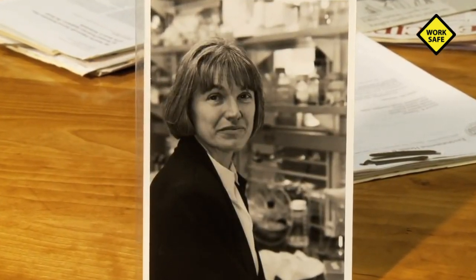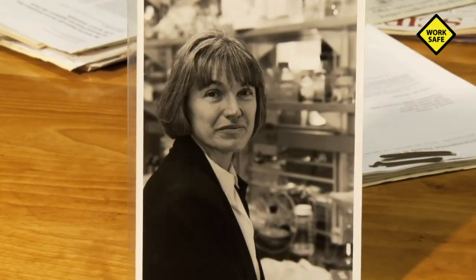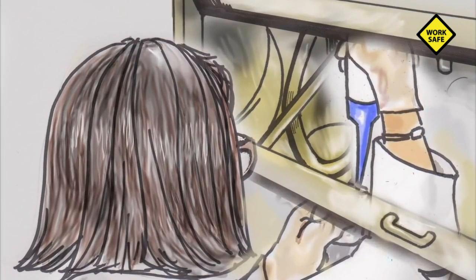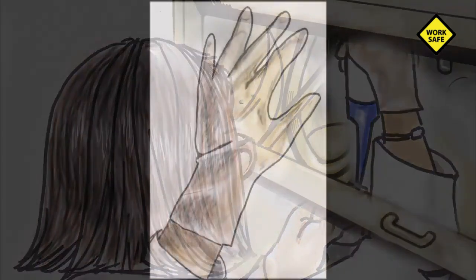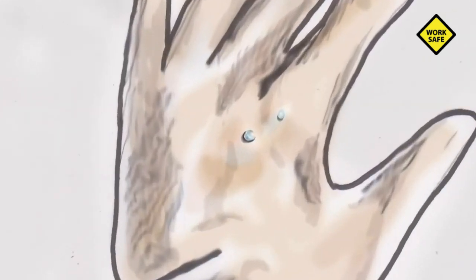In August 1996, acclaimed professor Karen Wetterhahn was conducting research on the biological impacts of heavy metals in her lab at Dartmouth College. She was working with small amounts of a highly toxic compound called dimethylmercury. She used a mechanical pipetting device to transfer the liquid compound while wearing latex rubber gloves. During this process, she later told colleagues, one or two drops landed on her gloved left hand.